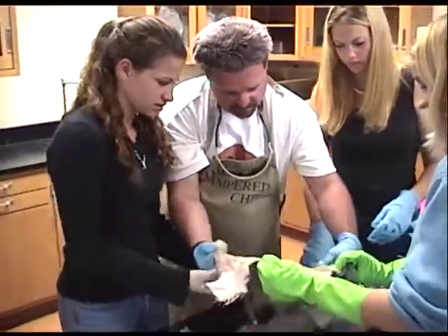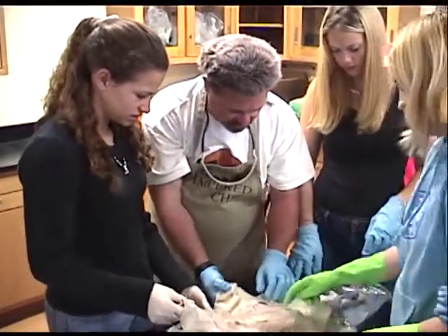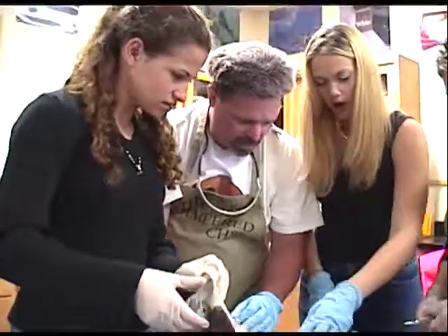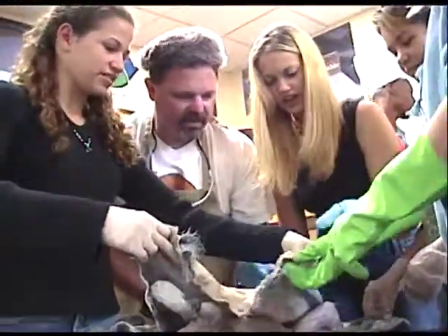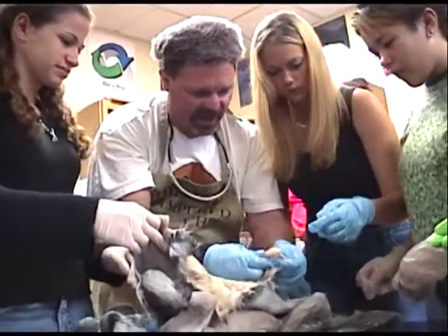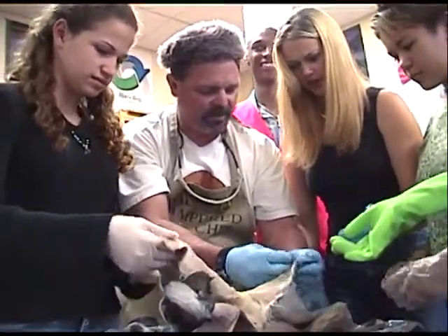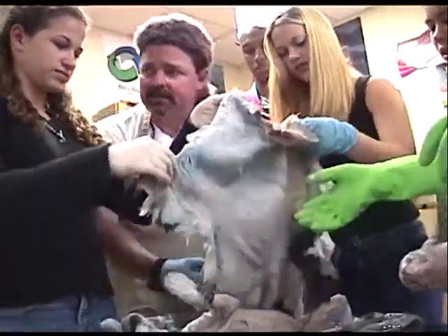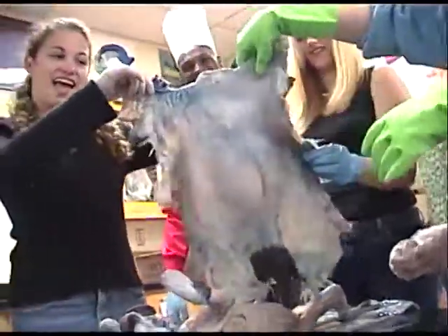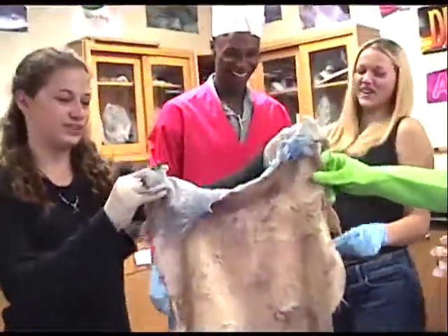That's okay. Alright, just leave it on. There's like a hard ball. Oh, I'll skirt out of it. There's like two — oh, right there. That thing. That's just a fat deposit right there. It looks like — that's fatty. Yeah, it's a fat deposit. It's gross. Hold up the skin. Yeah, hold up the skin. Turn it around. Alright, just leave it on your skin. She will find the different layers of the skin.